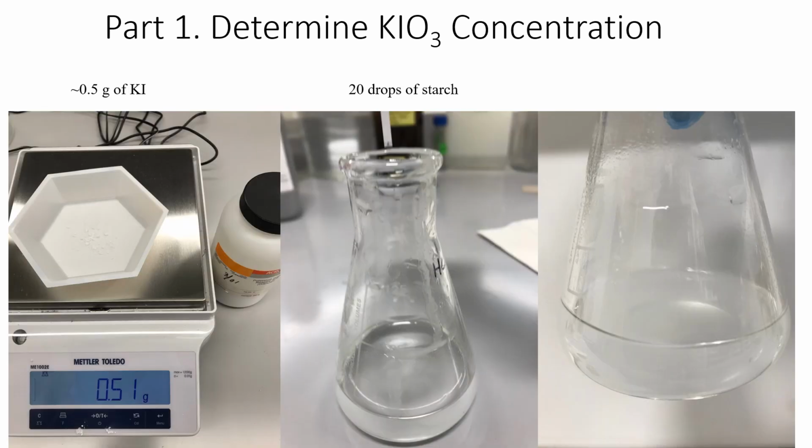Then I measured about 0.5 gram of potassium iodide, right? So this is enough iodide to be oxidized into iodine. This iodide added, as shown in the first equation you see in the previous slide, is in excess. You can barely see the powder in this weigh boat, because the color is also white.